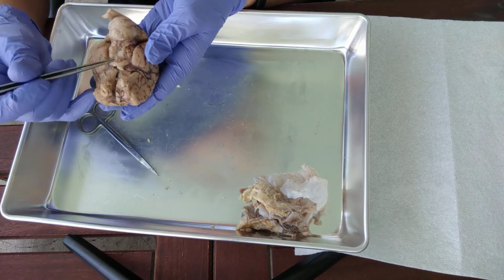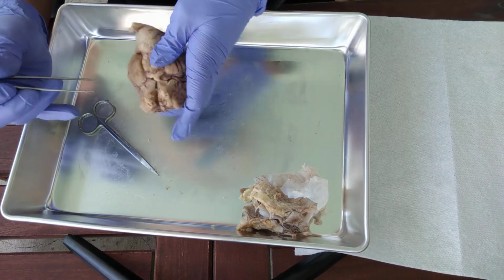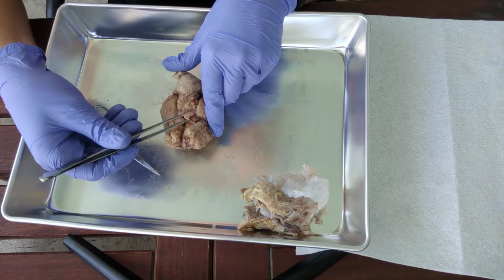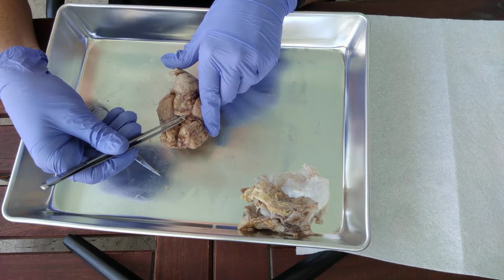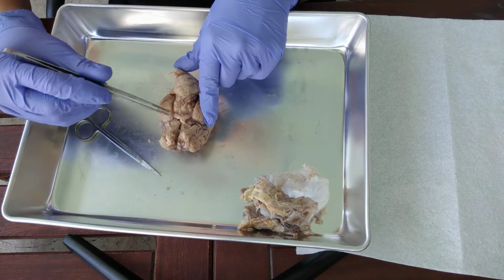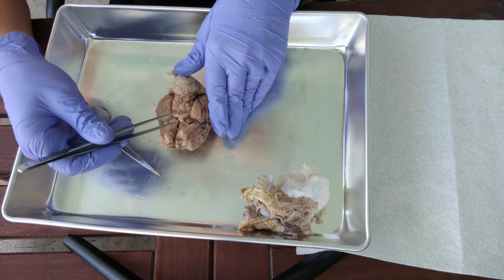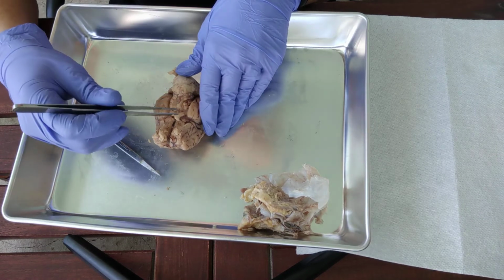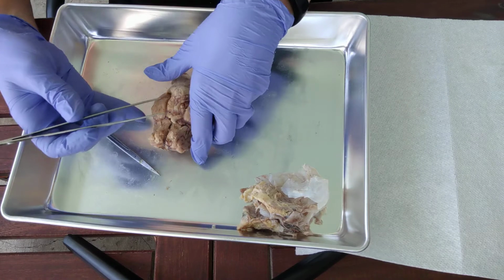See, mine again is destroyed a little bit. You should see a cross structure. Okay, a cross structure, and so remember that in front of the cross is the olfactory nerve. At the cross point itself is the optic nerve, optic chiasma, and then optic tract. Optic as in eye, for the eye.